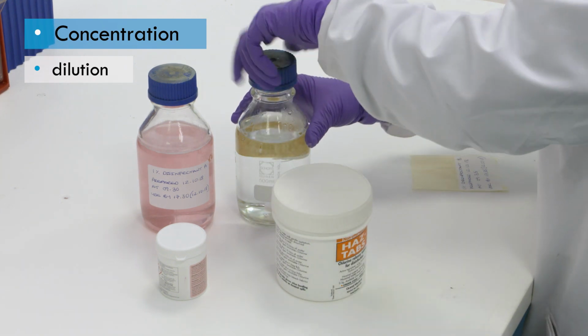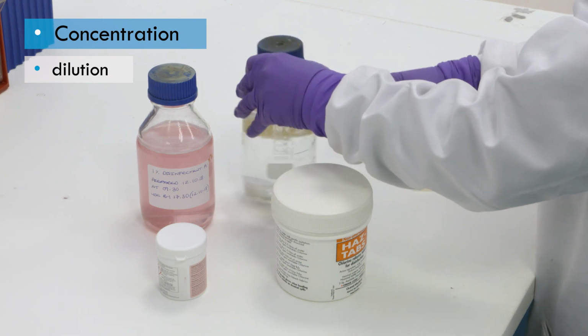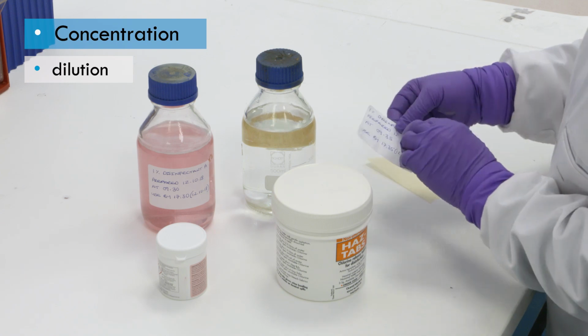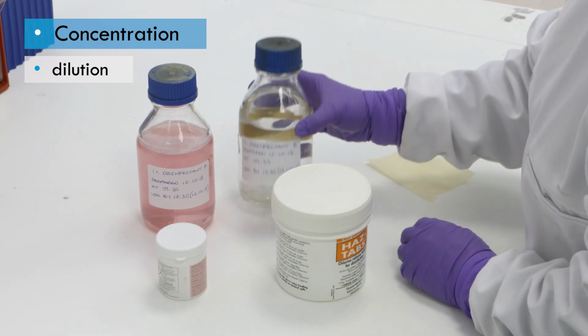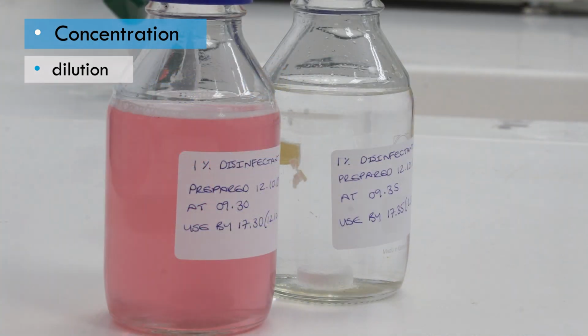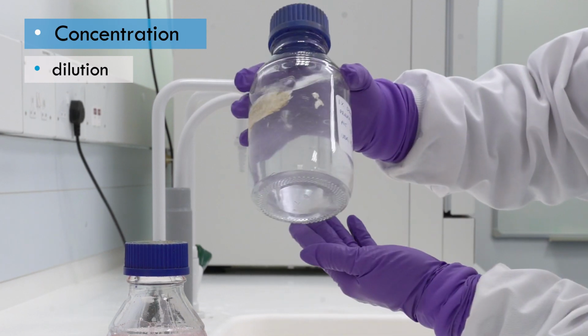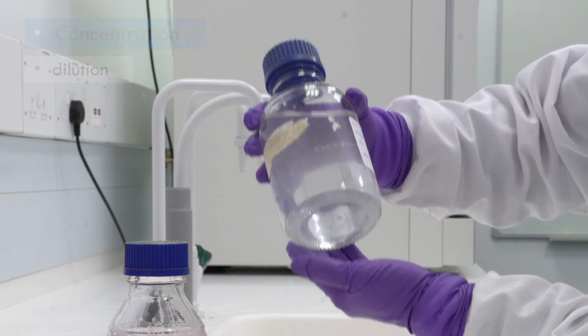Diluted disinfectants must be clearly labelled with the name and concentration, and the use-by time and date. Dilution will often shorten the shelf life compared to the concentrated form. The label must also indicate any hazardous properties, for example, if it is an irritant or flammable. The solid disinfectant must have dissolved completely and be thoroughly mixed with the water before it is used.